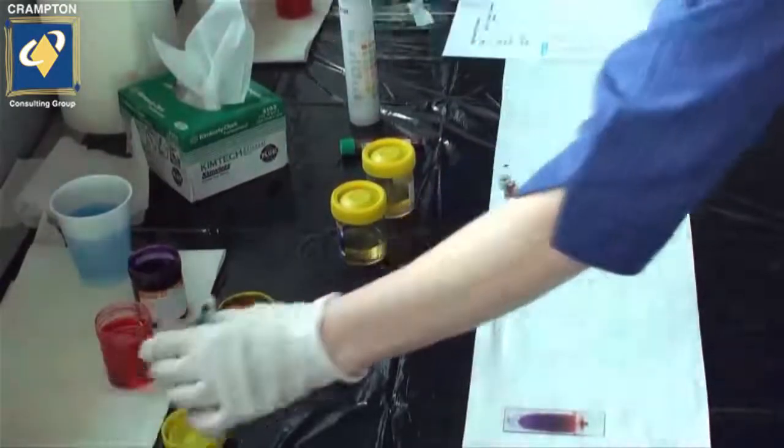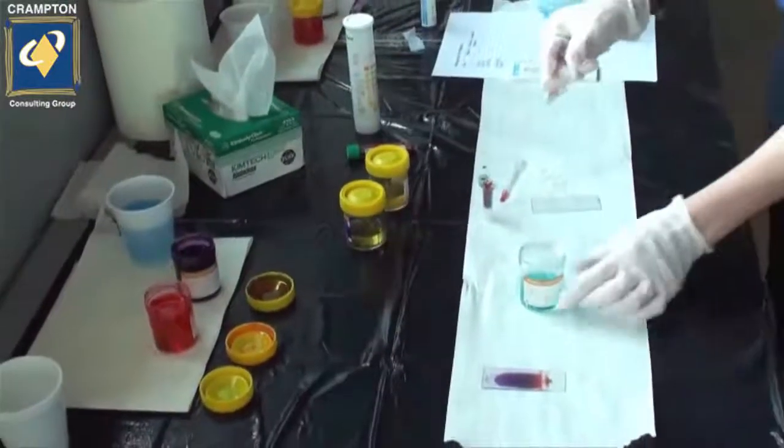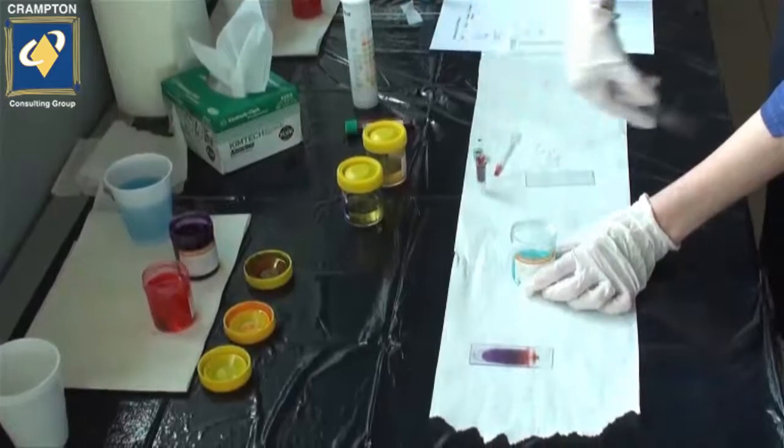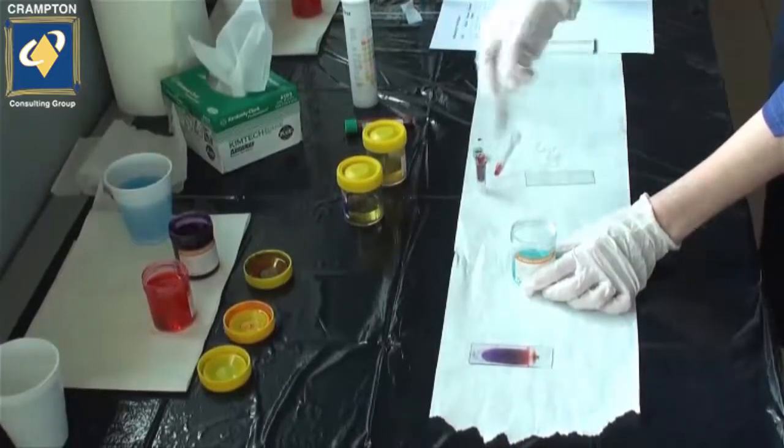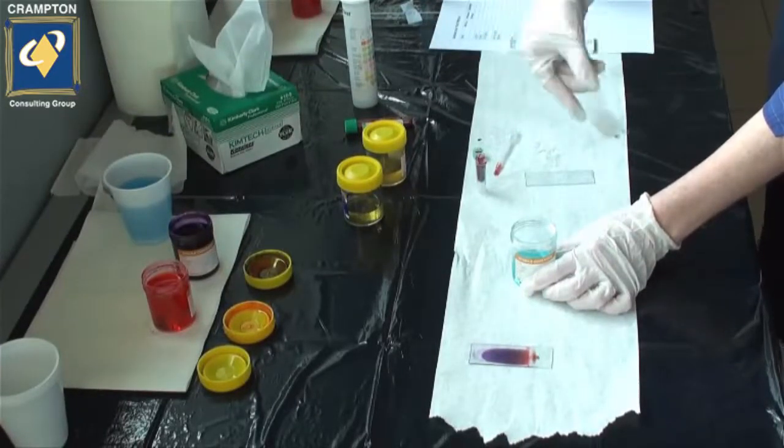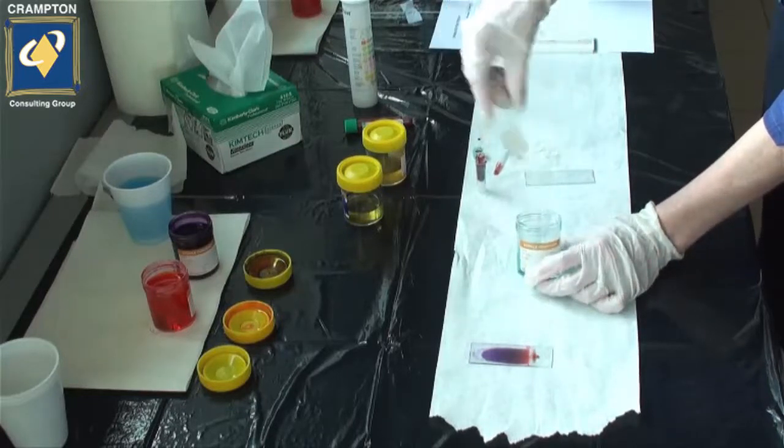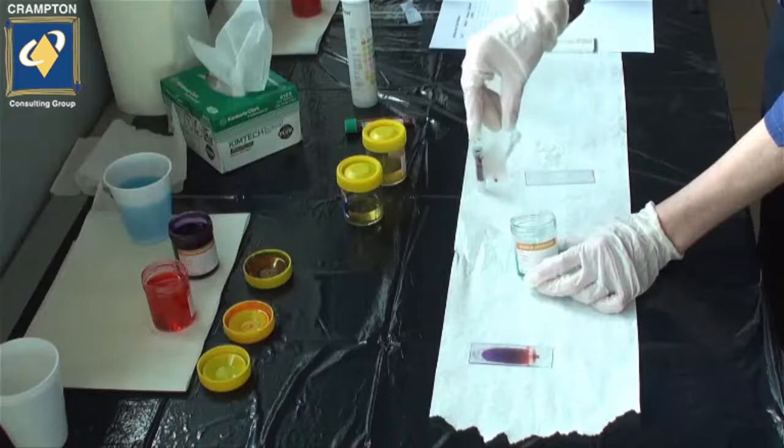We're now going to use the fixer, and again a very important reason for using PPE. These are chemicals, so ensure that your slide is adequately dried prior to fixing. Avoid the use of a hair dryer. This can damage the red blood cells.